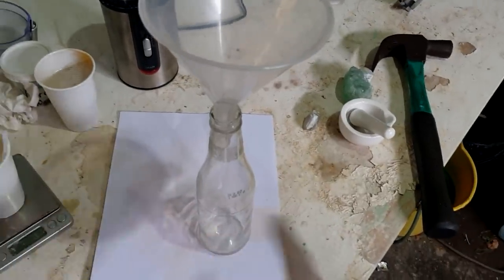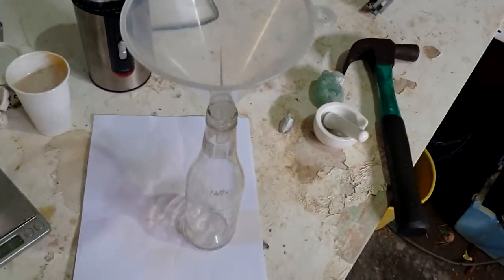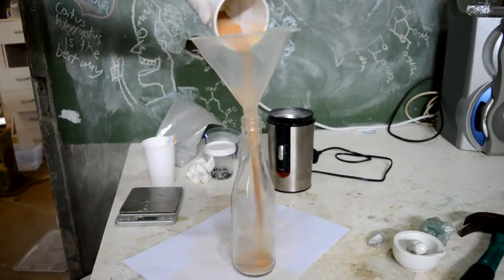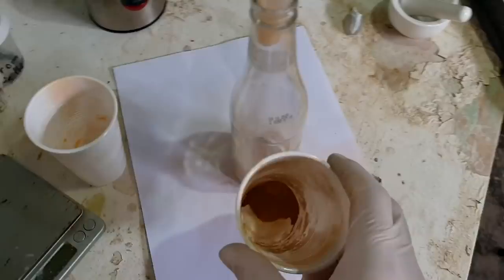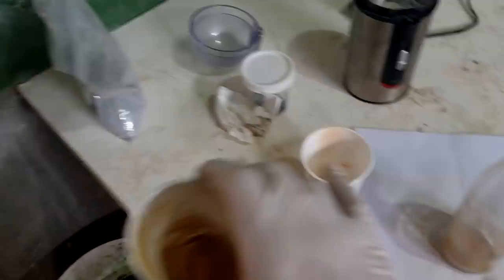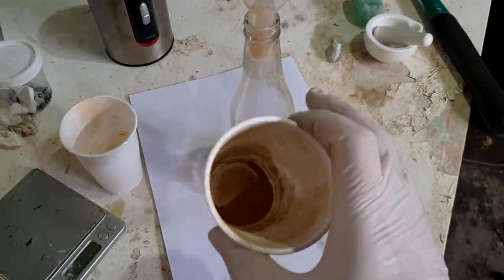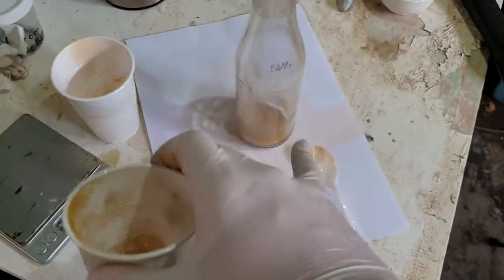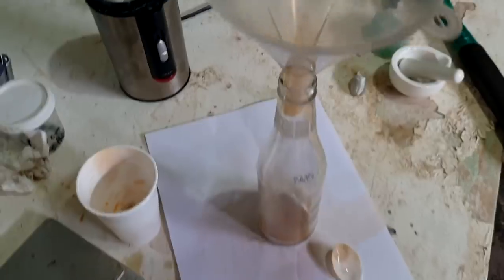I'm not going to just plonk this on the bench and set it on fire — that would be a bad idea. So finally I have three grams of just the stoichiometric mix of the vanadium pentoxide and the fine aluminium powder. This comes out of the 20 grams of vanadium pentoxide we put in — there's about 18 grams in the main mix, 2 grams here, and 1 gram of that fine powder. This primer is just going to help it get going at the start, so we'll put this in at the top.